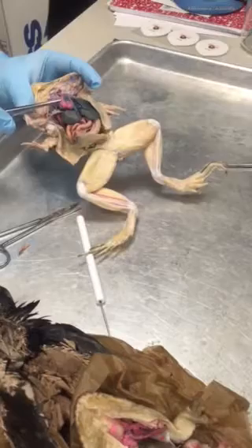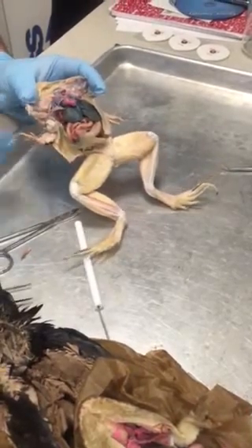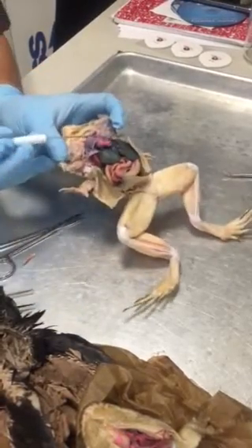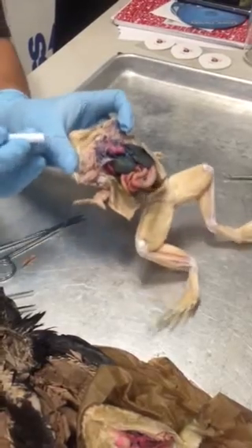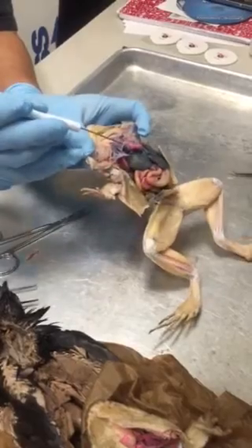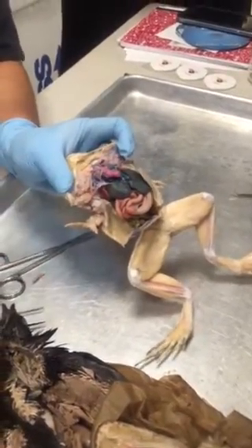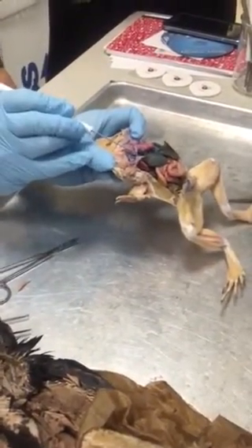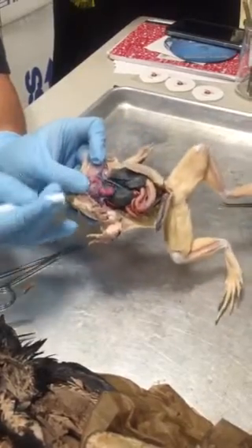So to make it really efficient, after blood is pumped from the ventricle for the second time, it's pumped out to the rest of the body through this big vessel. Okay, and there are 2 of them. There's one right here, and then there's one that goes off to the right side. These are called the aortic arches. Okay, there's one right here and one right here. And the aortic arches have 3 main branches.